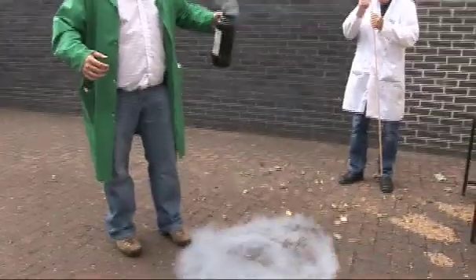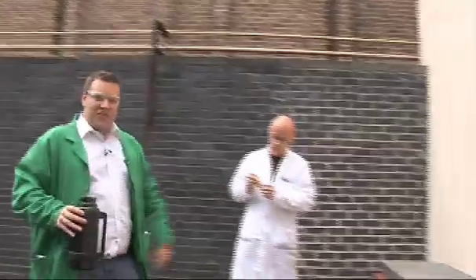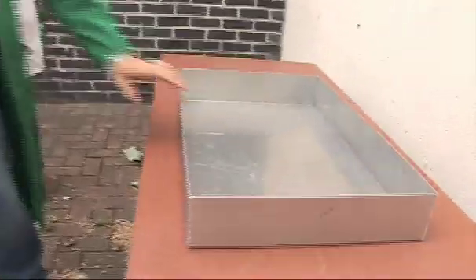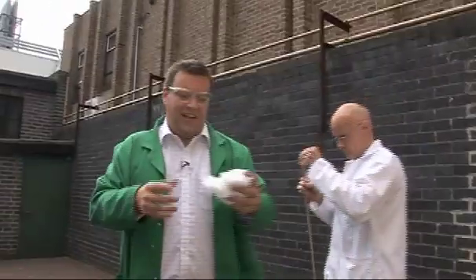You can see wonderful liquid oxygen — a nice blue colour. Over here on the table we've got a tin tray, which we're going to use to contain the experiment. We've got our liquid oxygen there, strongly oxidising, very, very reactive.